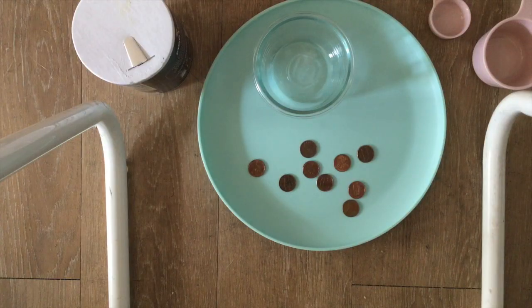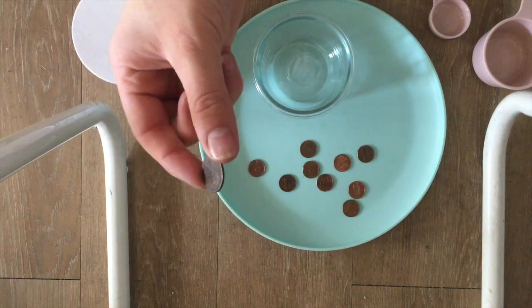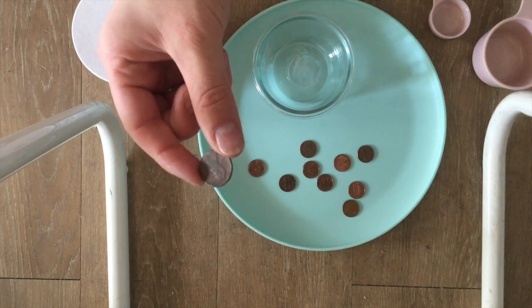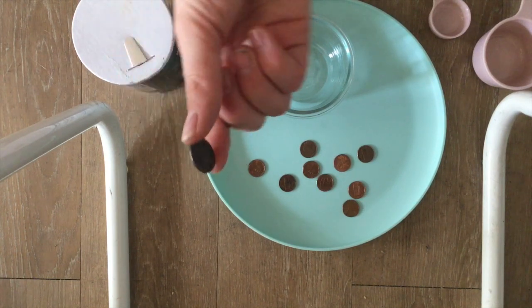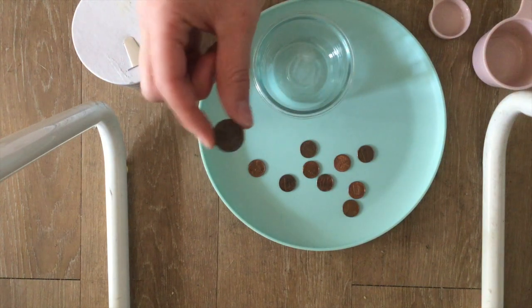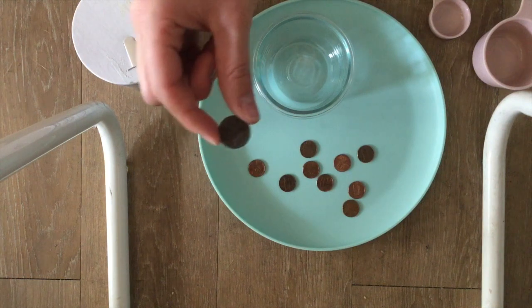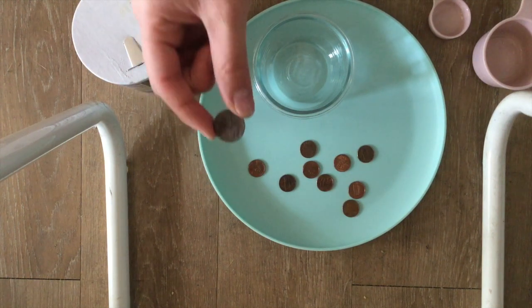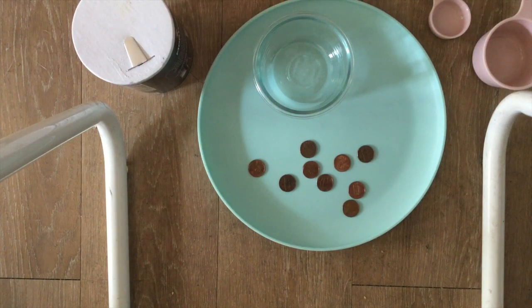Before we begin this reaction, I would like to show you what the copper oxide looks like up close on the pennies. As you can see, as I described, there is a greenish film on top along with a dull looking penny. Our goal is to show the reaction that I have described with the chemical equations, and what it will look like after it has reacted with the sodium chloride, NaCl, and vinegar.